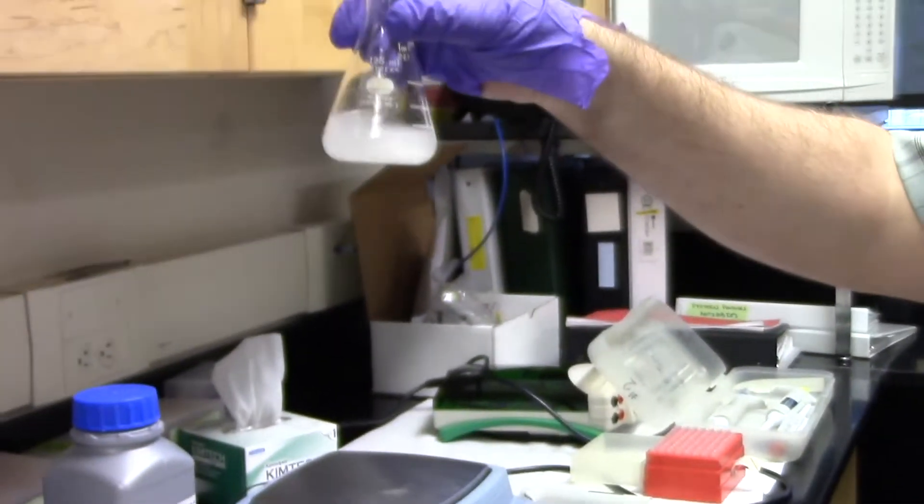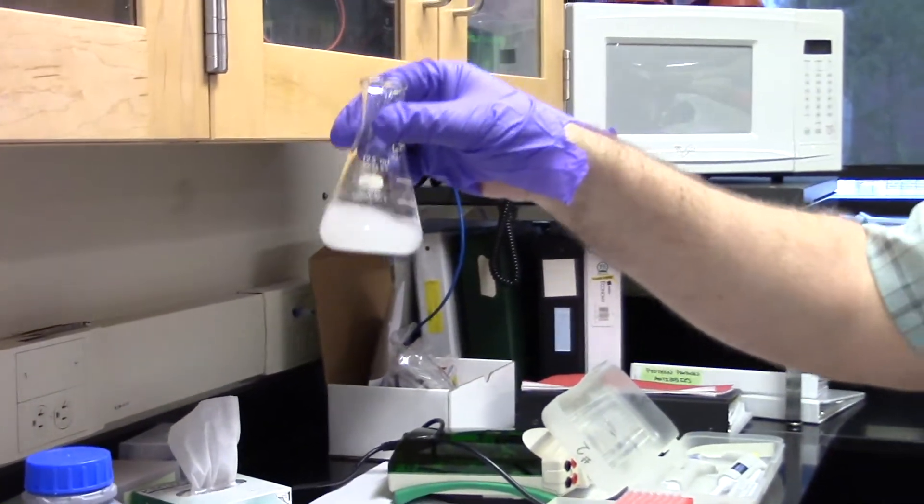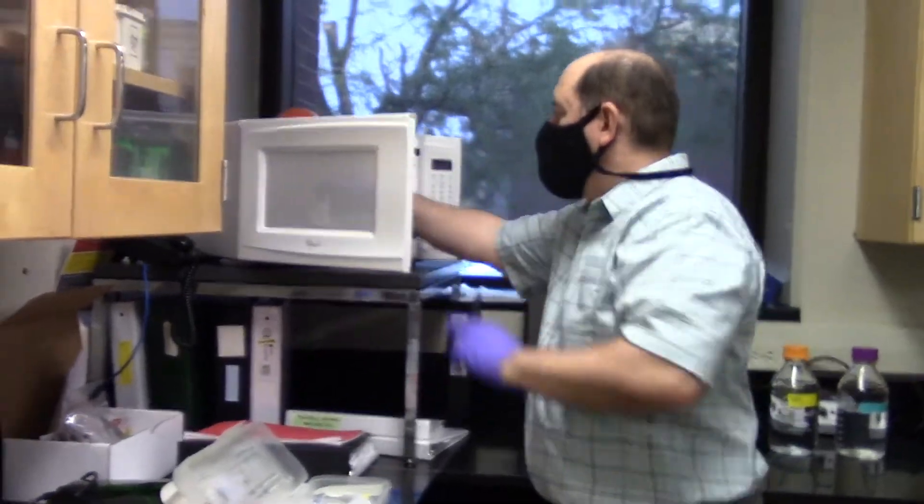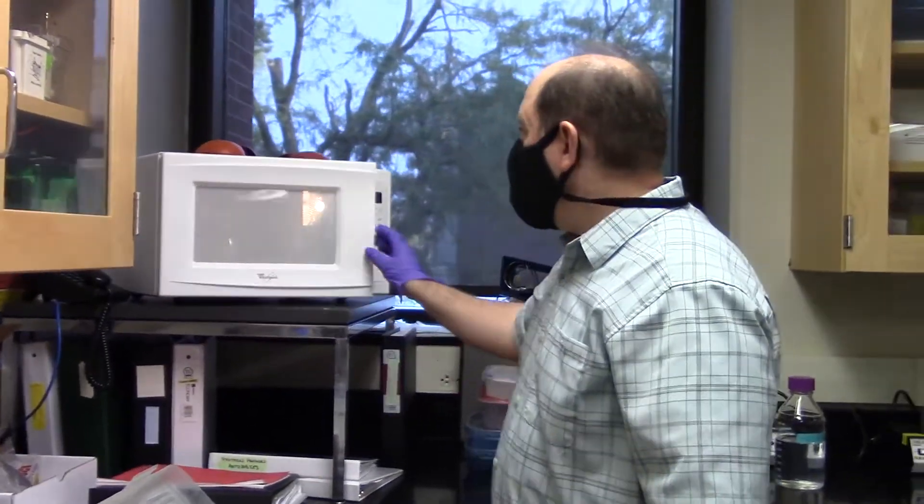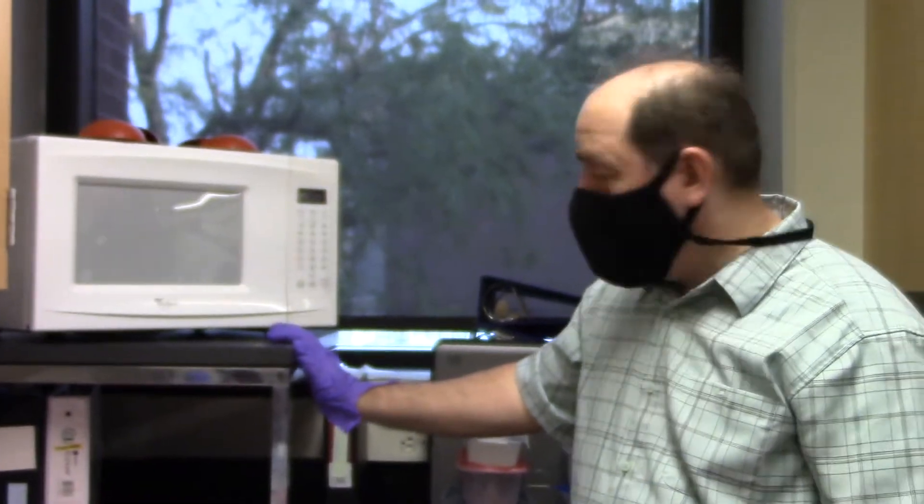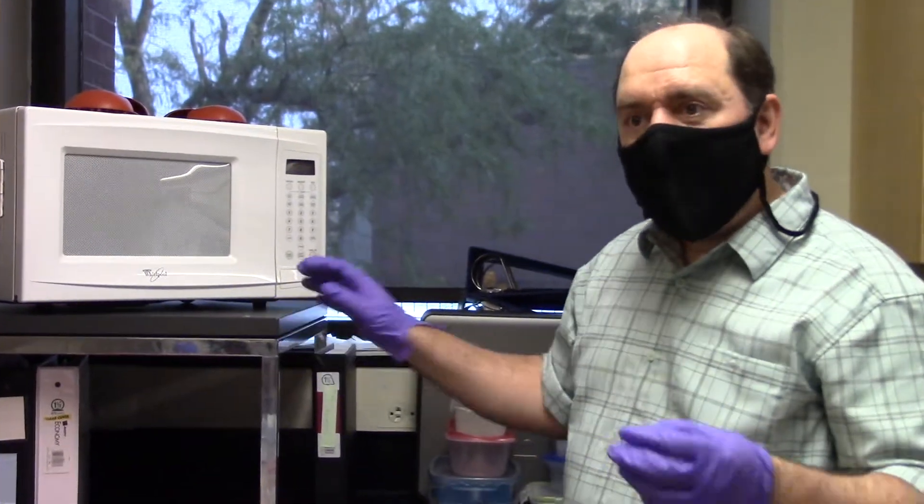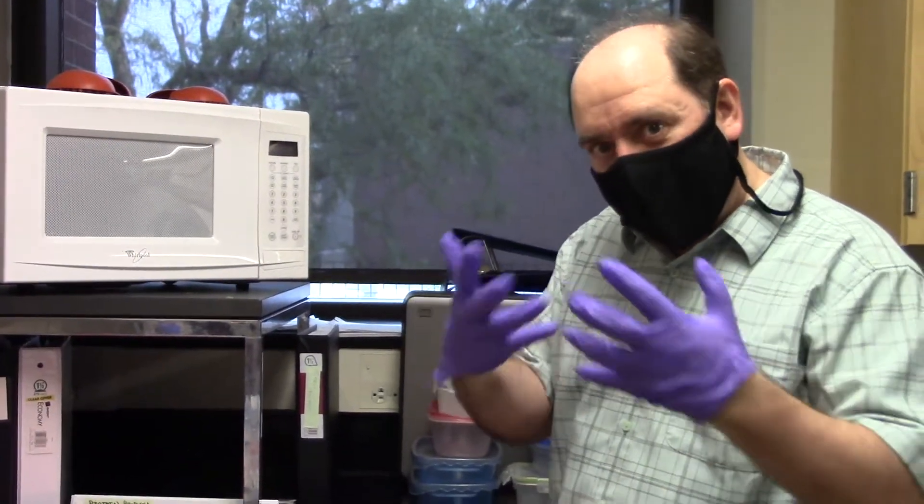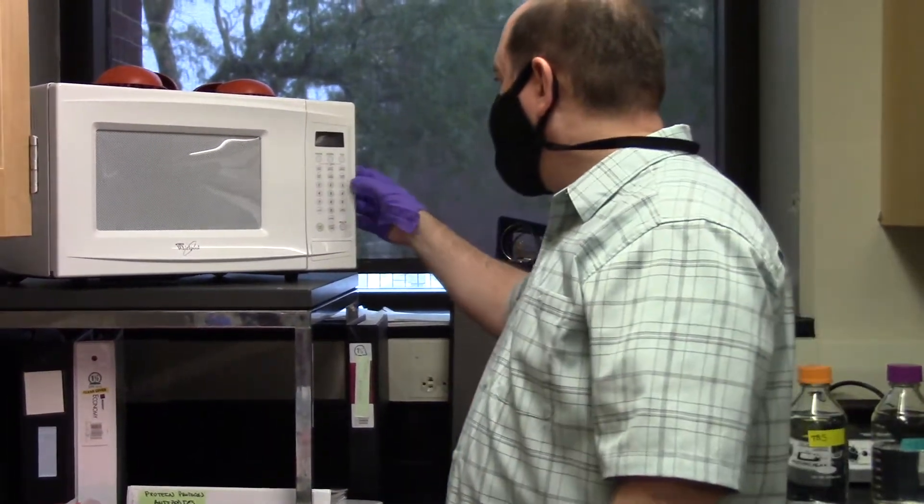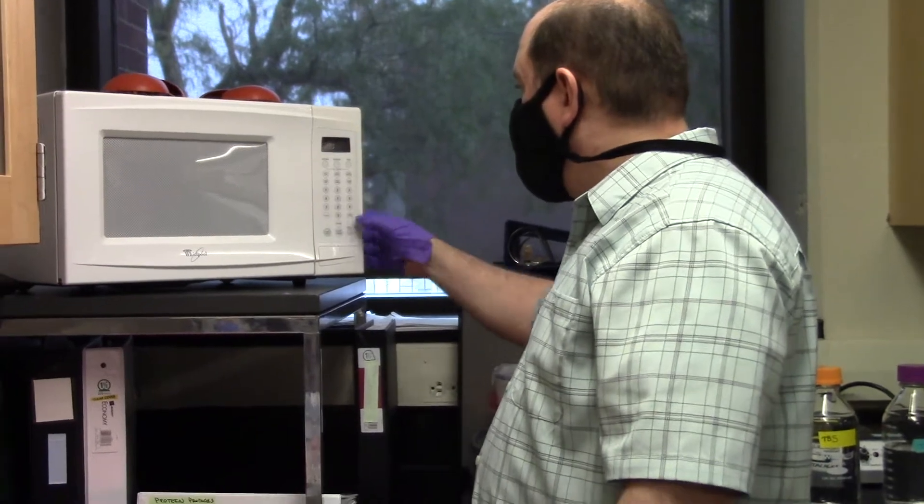White chalky solution. What I'm going to do now is microwave this. I'm melting the agarose powder into a liquid form where when it cools, the polymers of agarose fibers will form a meshwork that the DNA needs to travel through. So we can do about 30 seconds, 20 to 30 seconds.